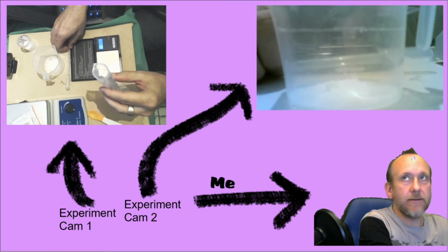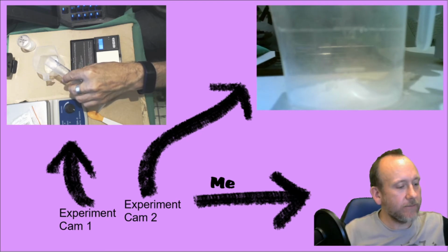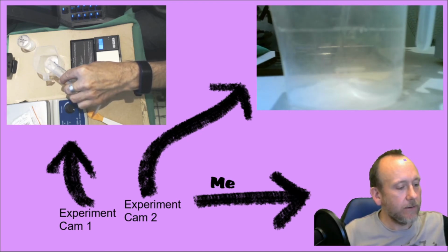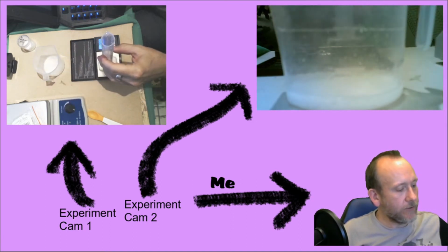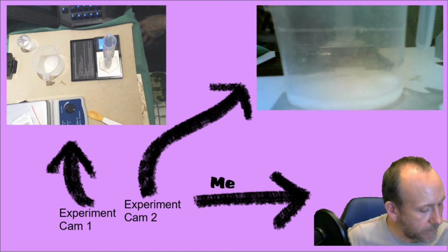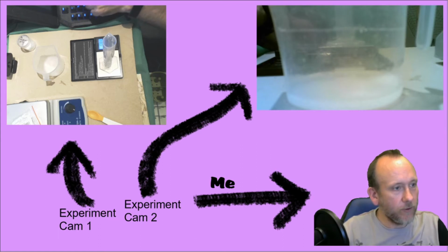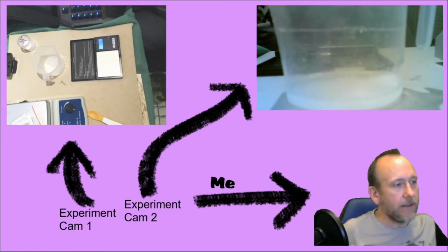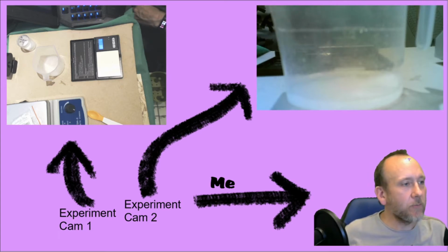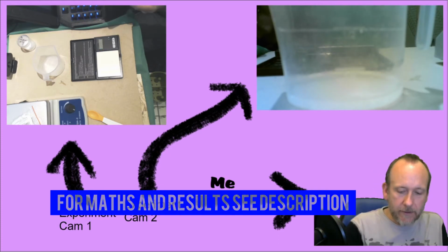I'm going to add the vinegar to my reaction vessel. Now it's going to react, and I'm going to re-measure the measuring cylinder, and that's 17.31, because some of the vinegar is probably stuck in the measuring cylinder. You can see that it's pretty much the same result as before, 7.92.